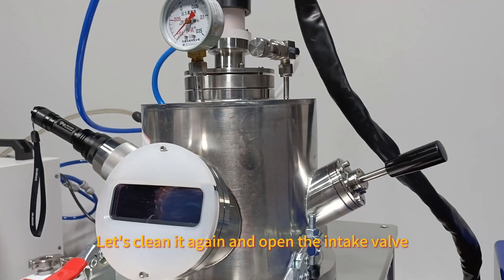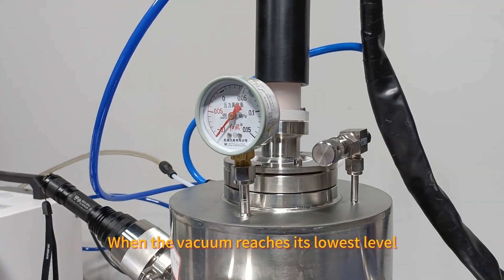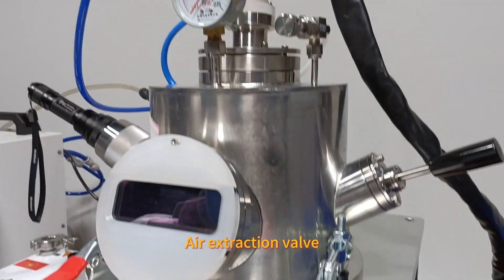Let's clean it again and open the intake valve. When the vacuum reaches its lowest level, then close the air extraction valve.